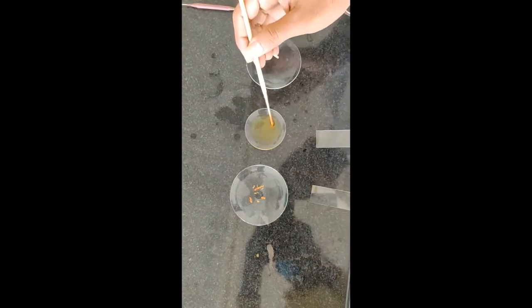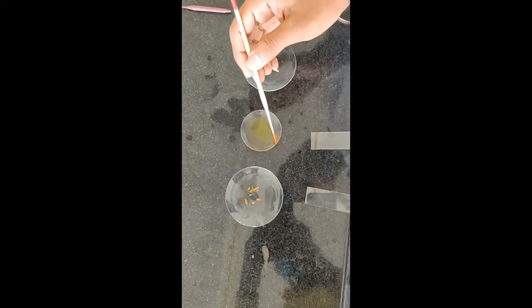Select the thinnest section and transfer it to the staining solution using a camel hair brush, and wait for 2 to 3 minutes. After 2 to 3 minutes, take the section from the staining solution and add it to a watch glass containing water to wash out excess stain from the section. Now transfer the section to the glass slide using a camel hair brush.